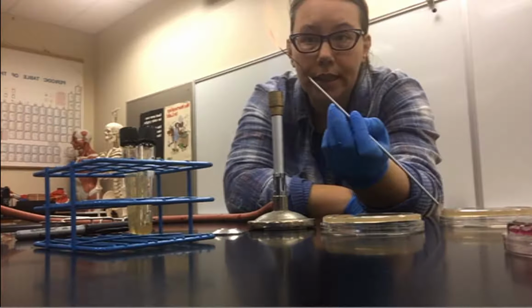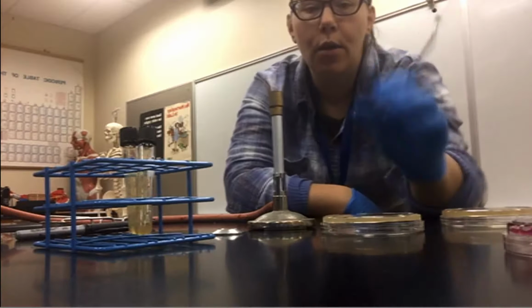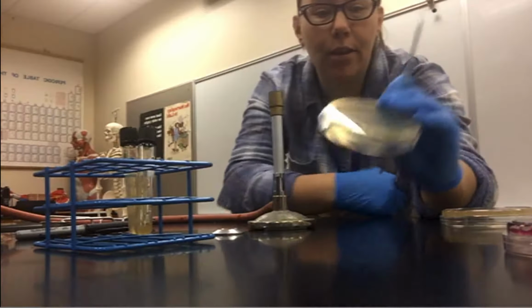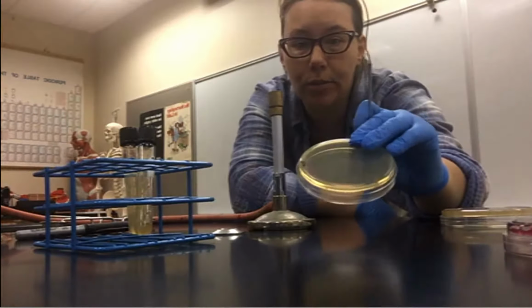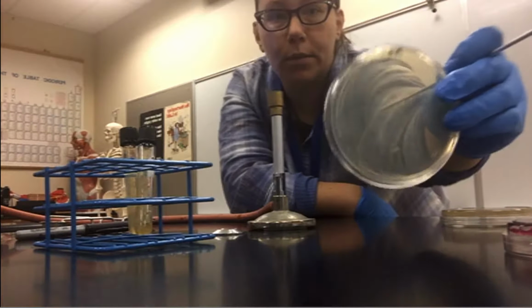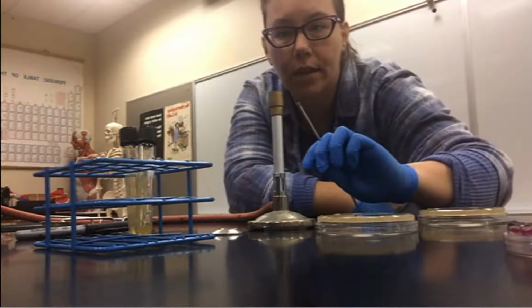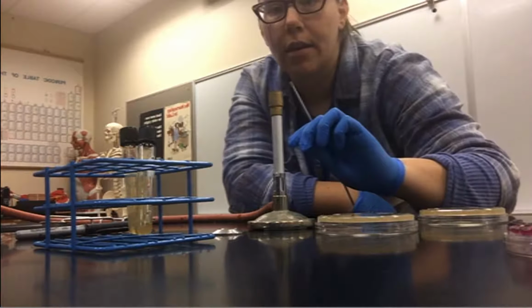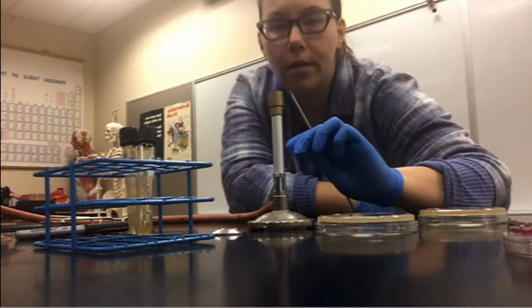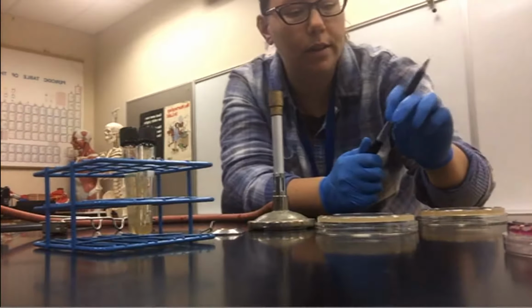For each of these labs, you're going to get 2 plates. So your group will probably have 4 plates in front of you total. One's going to be labeled for the lab, and the other one's going to be a nutrient agar. So I'm going to go ahead and do the PEA plates. So they're going to be labeled PEA, and your nutrient agar will probably have an NA on there. I'm going to have you put both the gram positive and the gram negative on the same plate. So this is a little different labeling system.